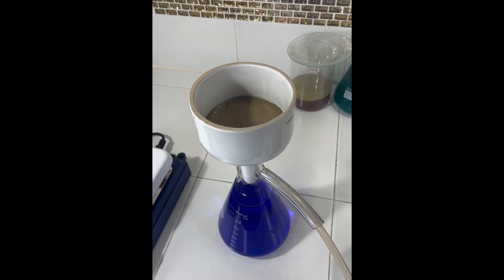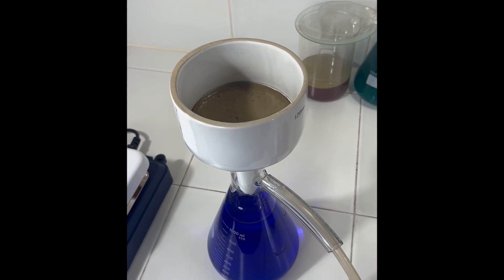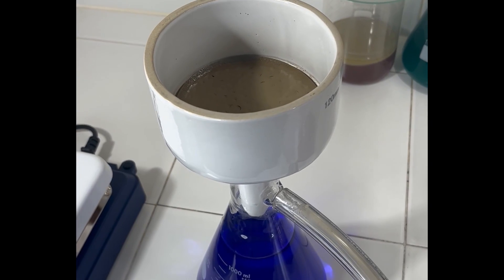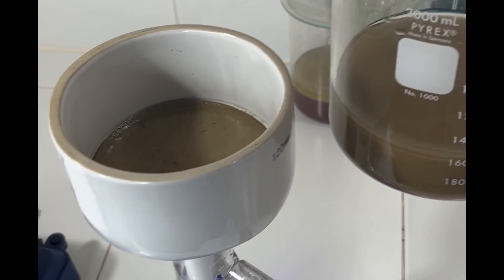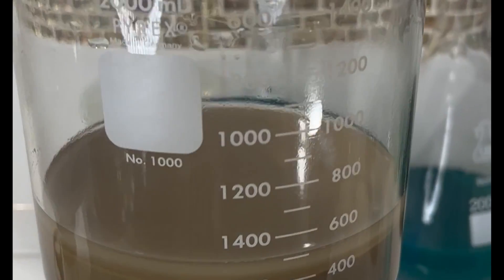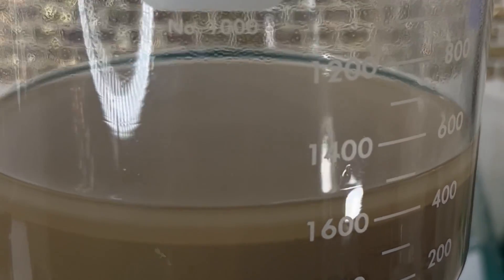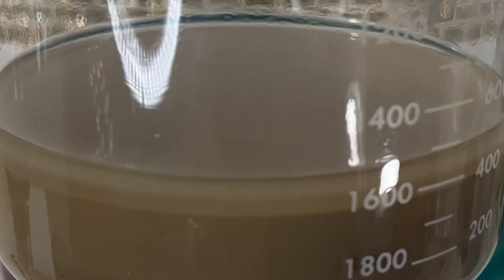Here it's important to get a good filtration because this is a good separation point to get the antimony and the lead out of our slimes. When you rinse, you'll see that you can get a very clear rinse — I have about one or two more rinses, but this is only after two rinses.